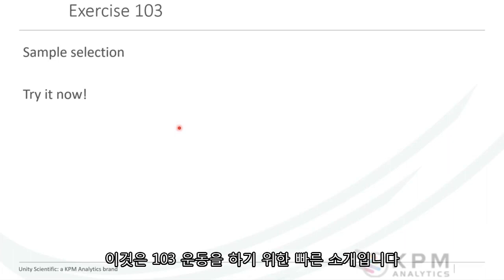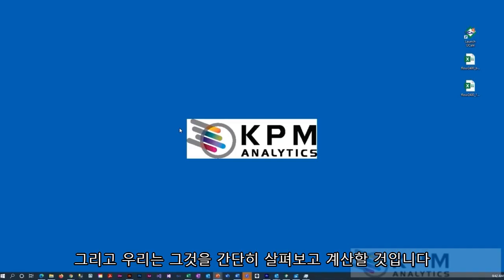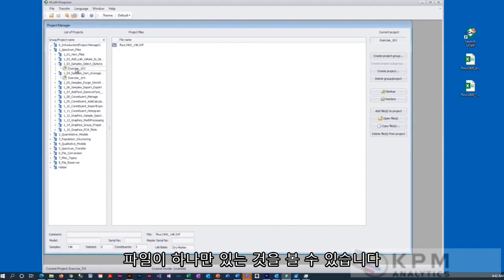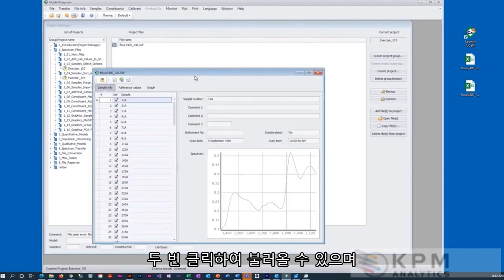So this is a quick introduction to exercise 103. And we will take a quick look at UCal. So if you open up UCal and you've got your exercise samples in here, if you click on 103, you can see that there's only one file there. You can double click and bring it up.